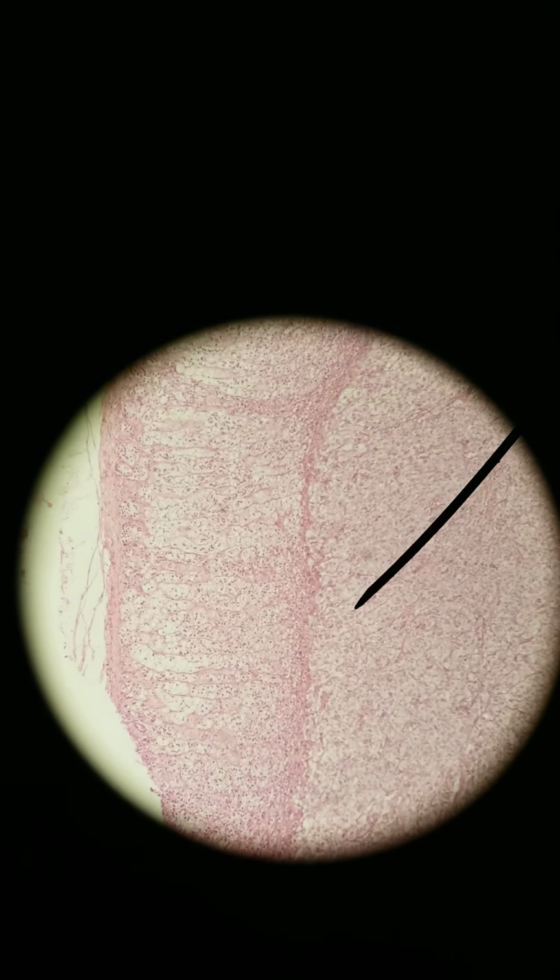All right, what I want you to know about the adrenal medulla, these cells here. So once again, this is cortex. And then you can see this dark line. That's the border from cortex to medulla. The cells that you find in the medulla are called chromaffin cells. They are regulated by the sympathetic nervous system. So there's neurons that come from the spinal cord, preganglionic neurons that extend from the spinal cord to these chromaffin cells. So this is part of the sympathetic nervous system.